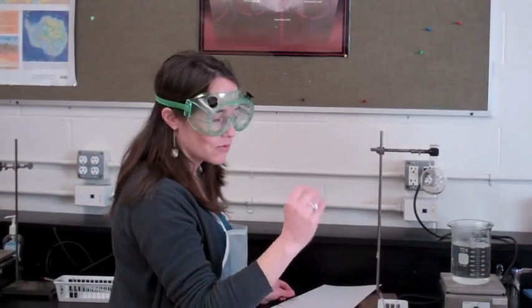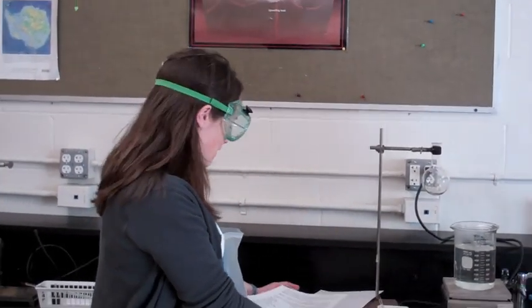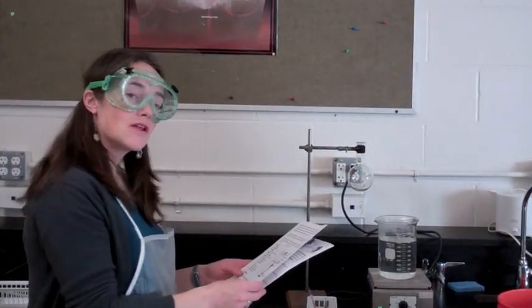This is the Uncommon Cold with Mr. Phipps and Ms. Gardner, perfectly placed because we both have colds. I'm going to be reading the procedure. Mr. Phipps will be carrying out the procedure.